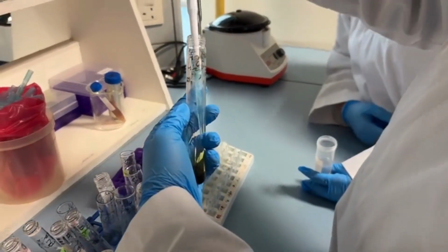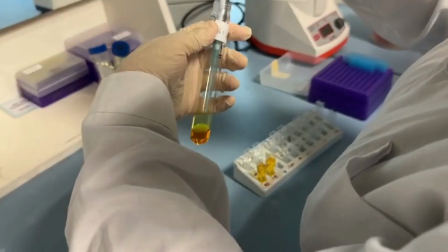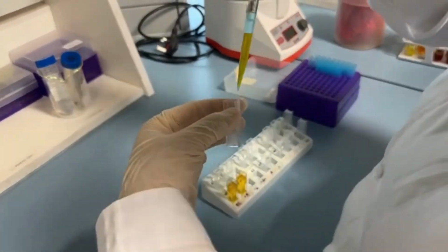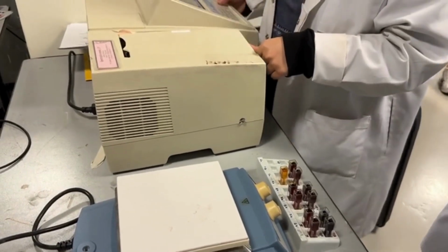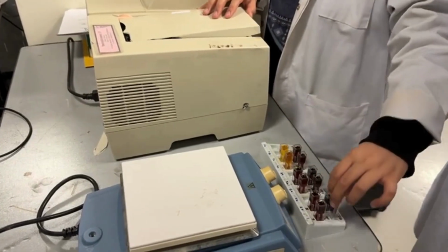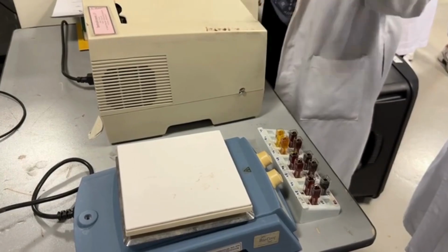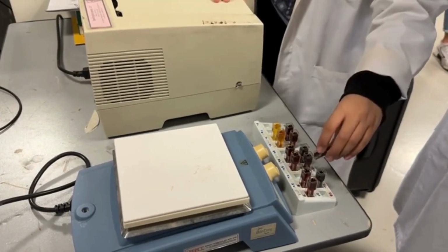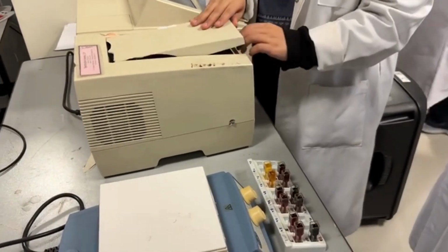1 ml of Rochelle salt is added. Then, the solution is transferred into a cuvette. The absorbance of the colored solution at 575 nanometers is read using test tube 1 as a blank. The readings are recorded and the relationship between the optical density and the concentration of glucose solution is plotted. Whether there is a linear relationship between the concentration of glucose solution and the corresponding optical densities is seen.